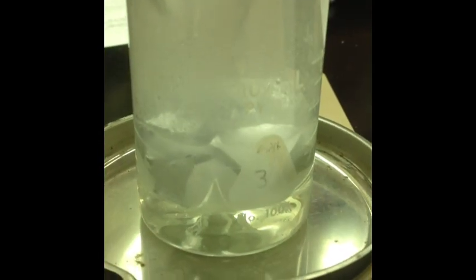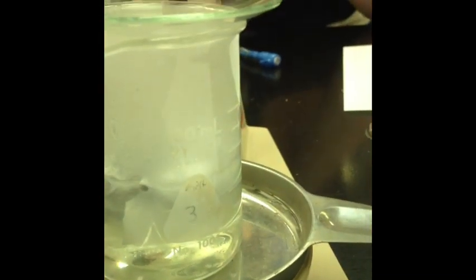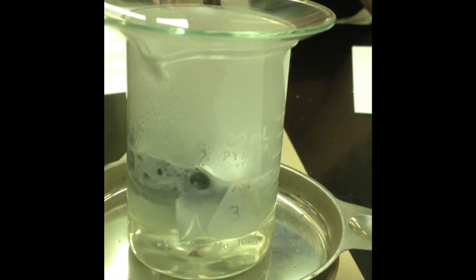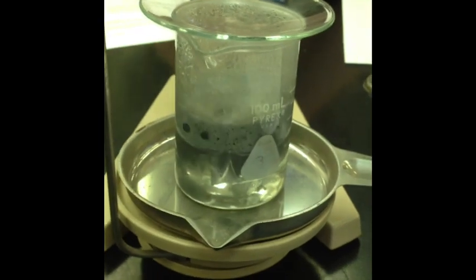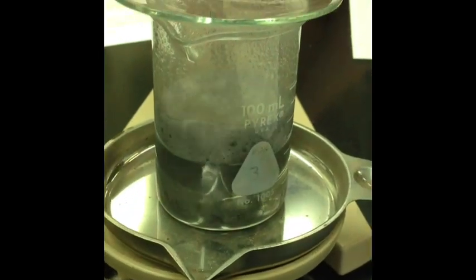It's smoking. You always pour hydrochloric acid into the water. Whoa! Holy crap, it's dissolving. Whoa.